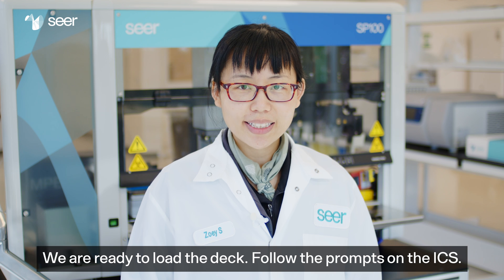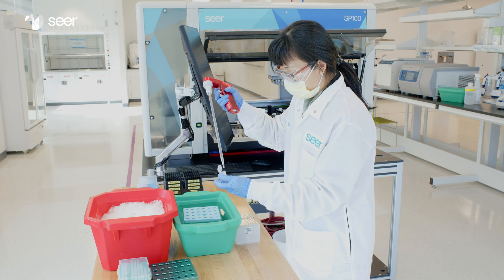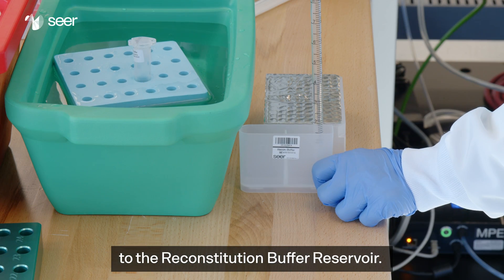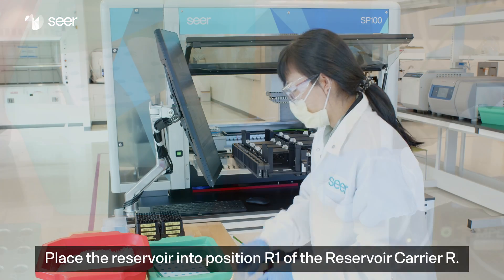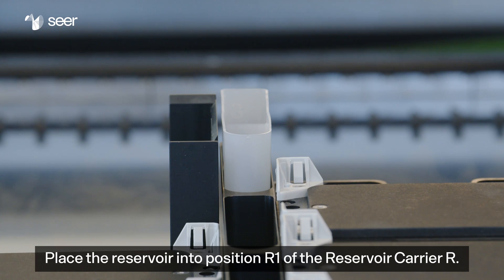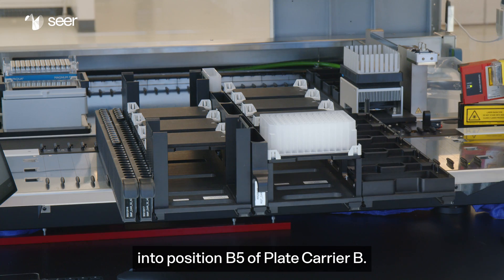We're ready to load the deck. Follow the prompts on the ICS. Add the peptide reconstitution buffer to the reconstitution buffer reservoir. Place the reservoir into position R1 of the reservoir carrier R. Place the peptide collection plate into position B5 of plate carrier B.